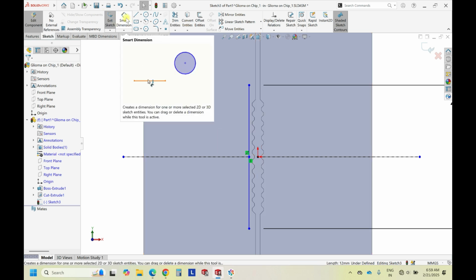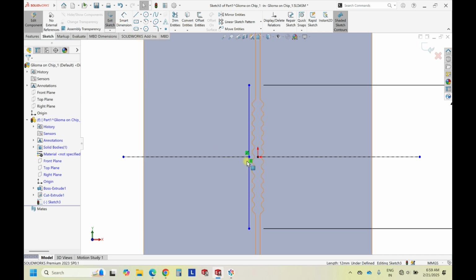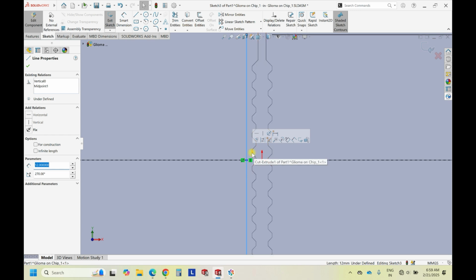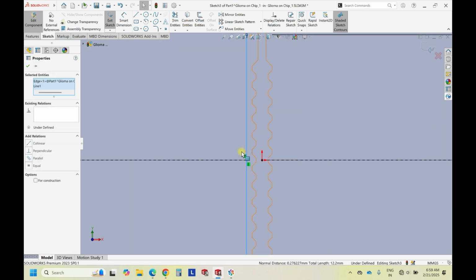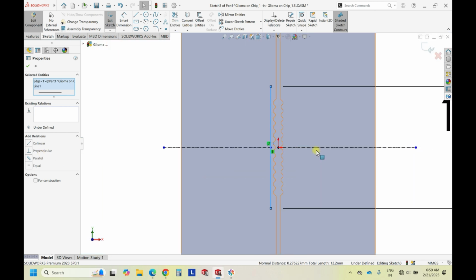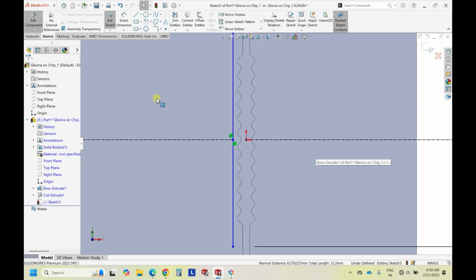So when you do the extrusion cut, this will result in the formation of thin sheets. So that operation won't be accepted. If you are connecting this line and the end of this sketch, and then you do collinear, and if you start sketching, it will lead to an error. So you cannot do extrude cut after your complete designing. So before that, what I'm doing, so let's do one thing.